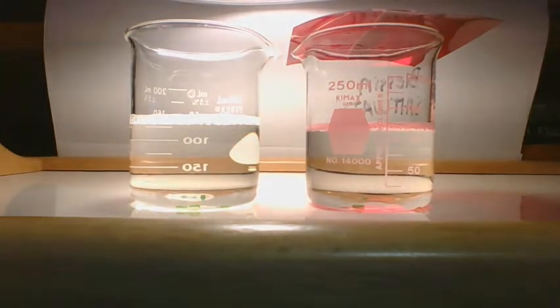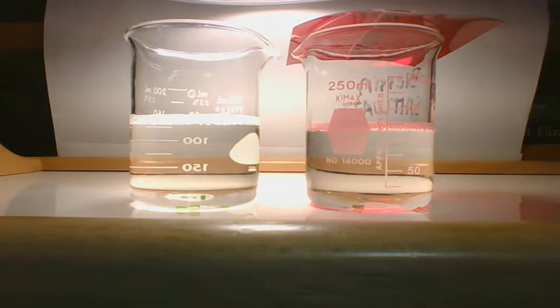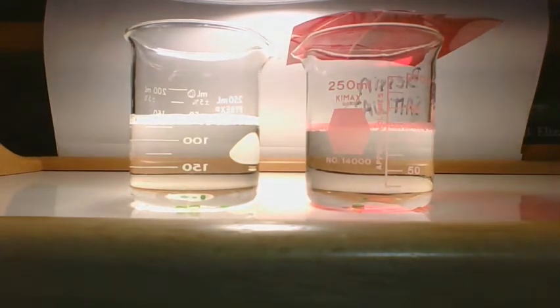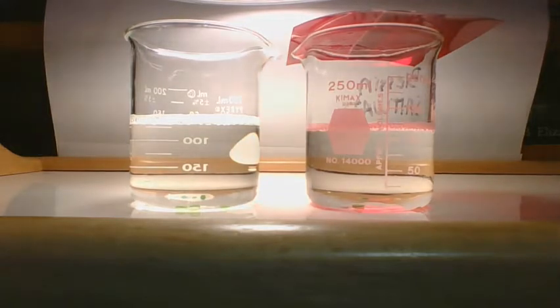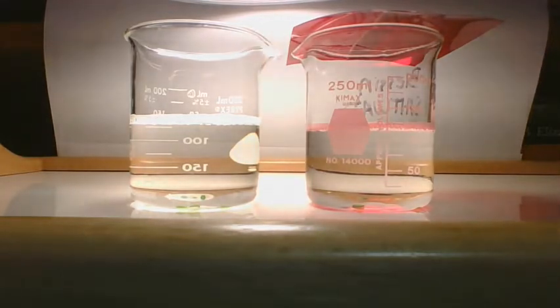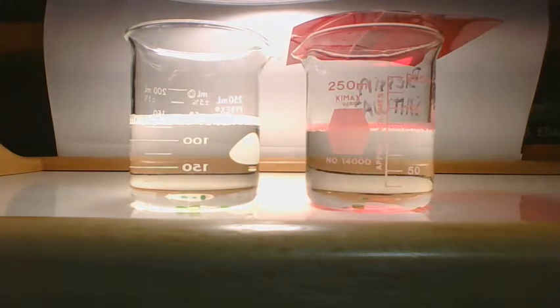Watch the discs, the leaf discs. We'll look for leaf discs to rise. Every minute you count what's on the top. When all 10 are up top, you can stop. Okay? So what I will probably be doing is telling you the numbers, because I don't know how well you can see them rise up. I mean, I'm sure you'll see them, but I'm not sure how well.